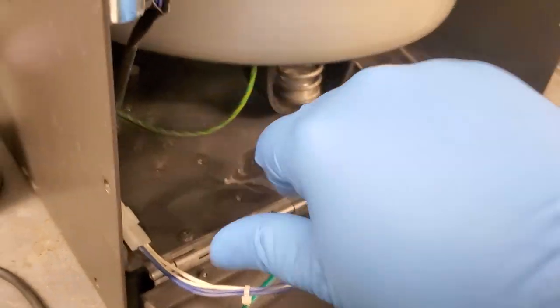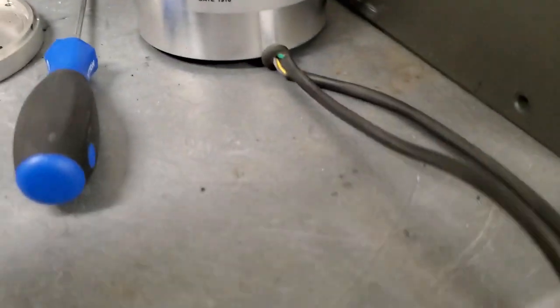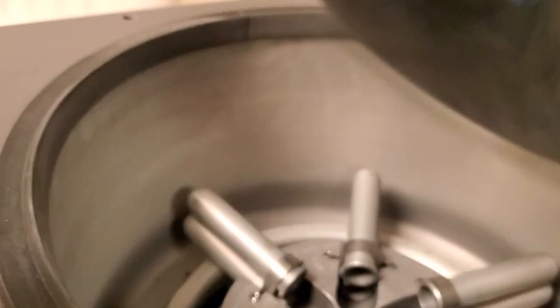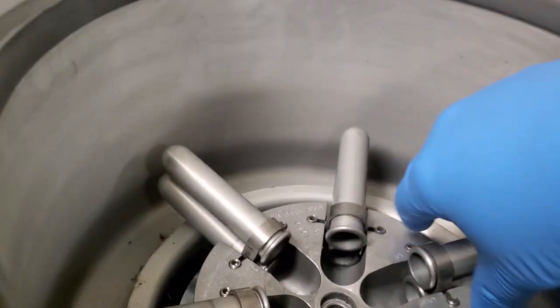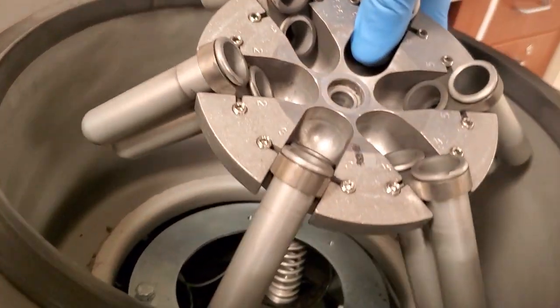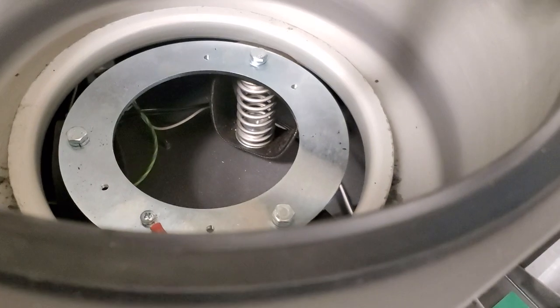So there is a weird dust that's collected on everything. And when I got in, this black, really fine dust was on everything. It was on the rotor. Here you can see the rotor. It was all over the rotor. It was up inside it.